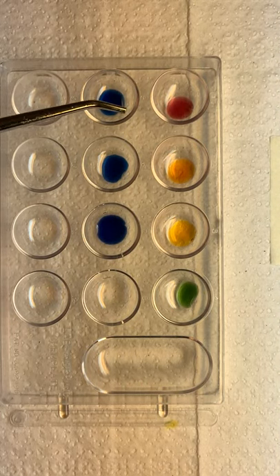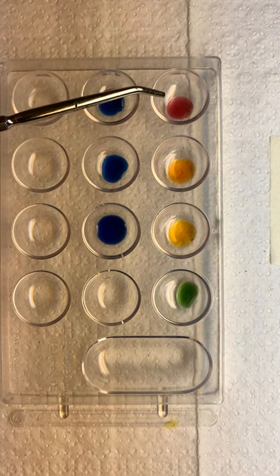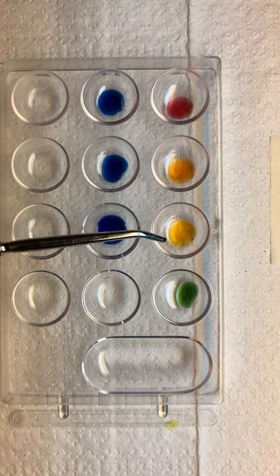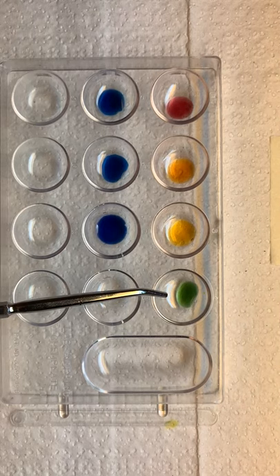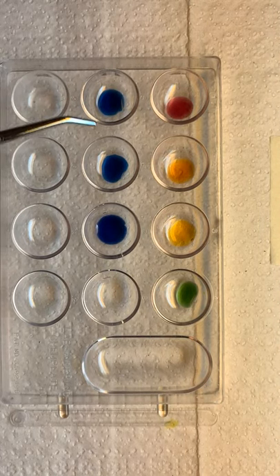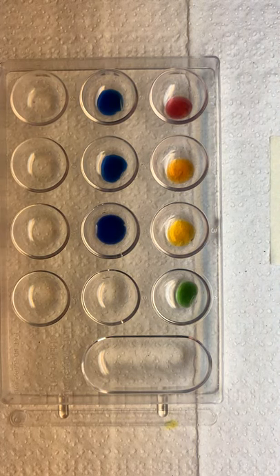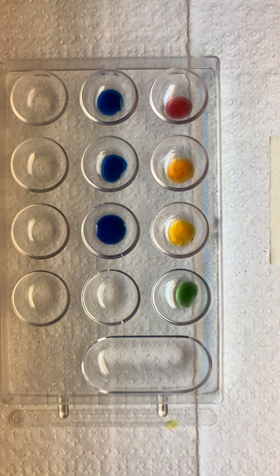We're going to describe each of these. You can call them what you will, but we'll just say this is red for Roy. So red, orange, yellow, green, blue, indigo, violet, or blue-purple, something that's got purple in it. Okay, that is activity three.